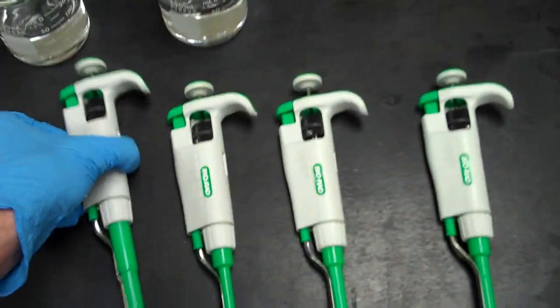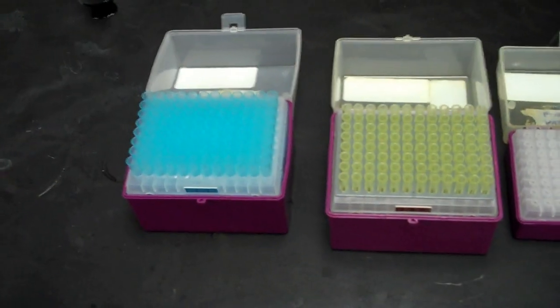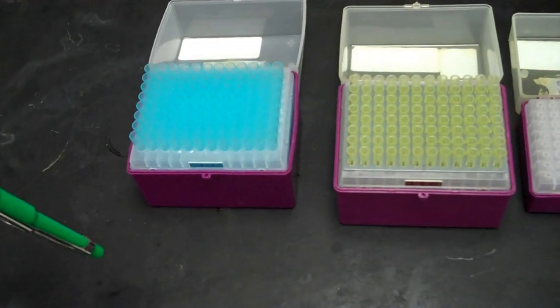Once you've chosen the appropriate pipetter, you'll next need to get a box of pipette tips. Choose the appropriate pipette tips for the pipetter.